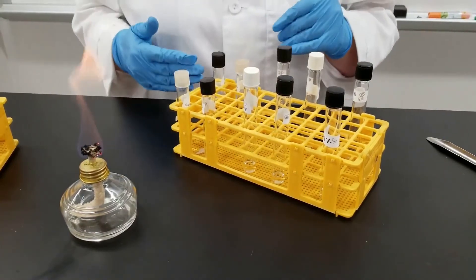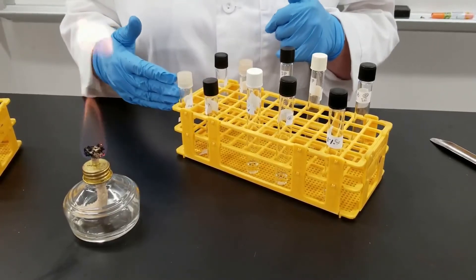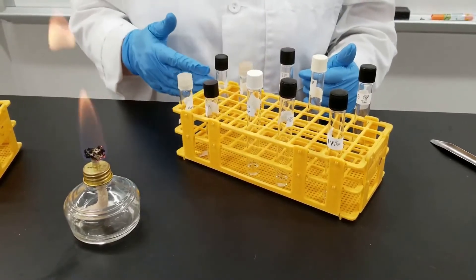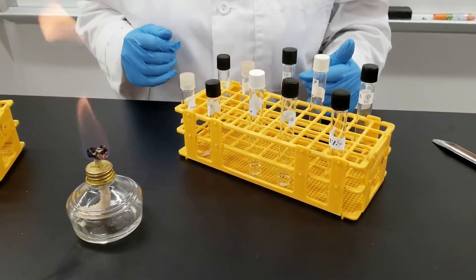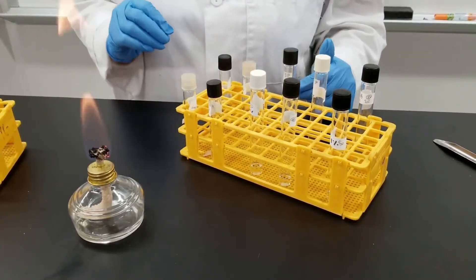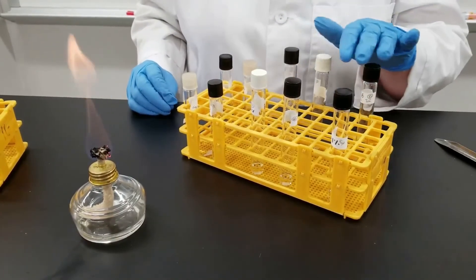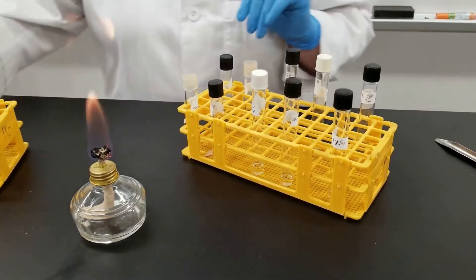We're going to use two different organisms today. One is Enterobacter, which is commonly found in the intestines and is gram-negative. The other organism we're going to use is Staphylococcus — Staphylococcus epidermidis. Staphylococcus is known to be able to grow in higher salt concentrations than most organisms, so we're going to see what effect the different concentrations of salt will have.